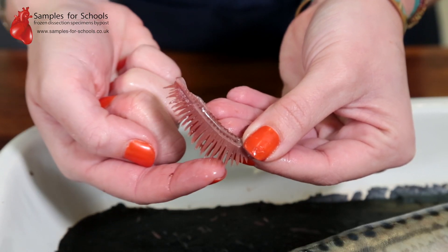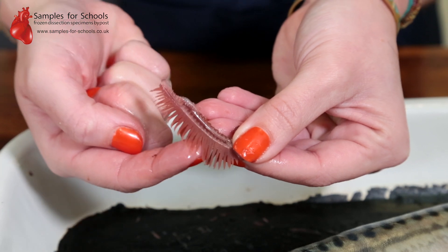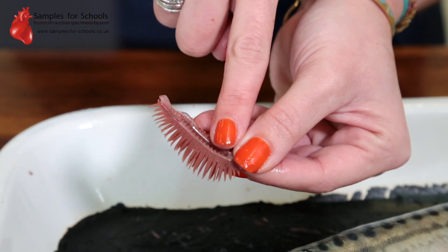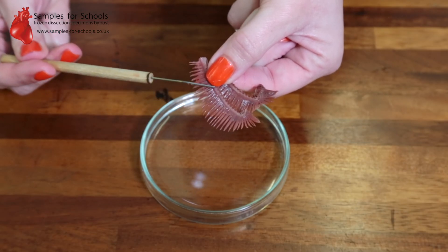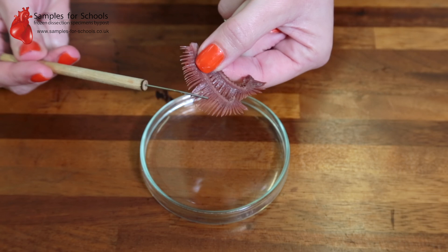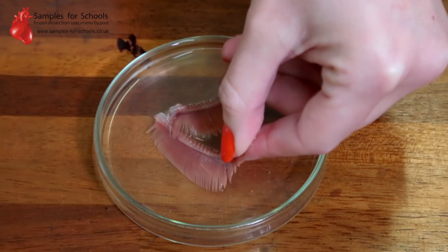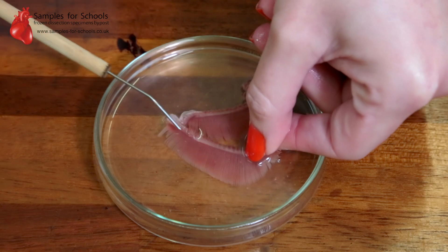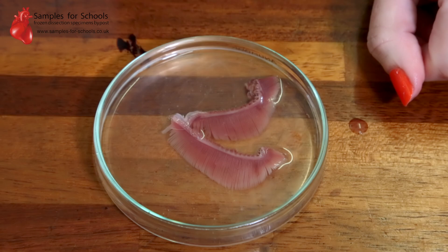The structure of the gills is made up of gill filaments which increase surface area for gas exchange and are held by the gill arch. When the fish gills are in air, you can see that the filaments clump together and have a reduced surface area. When you put them in water, the filaments fan out, much like a feather, giving maximum surface area for gas exchange.